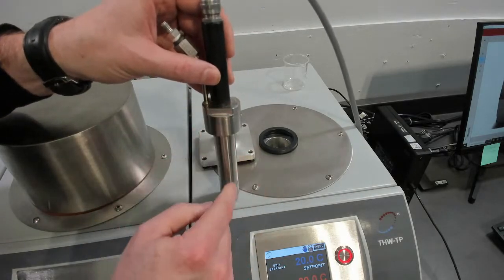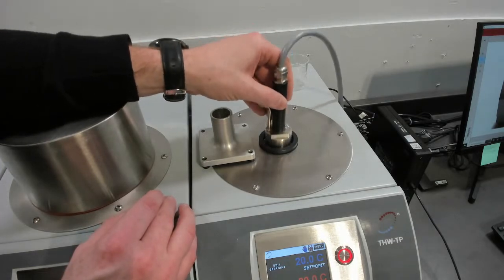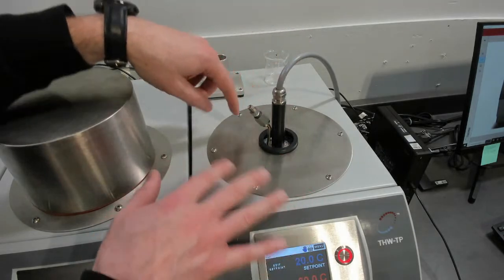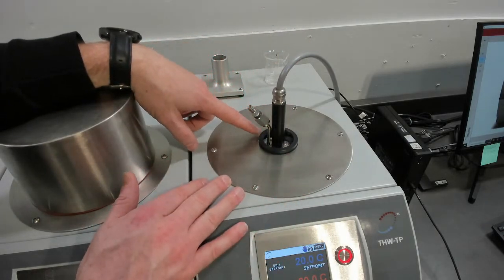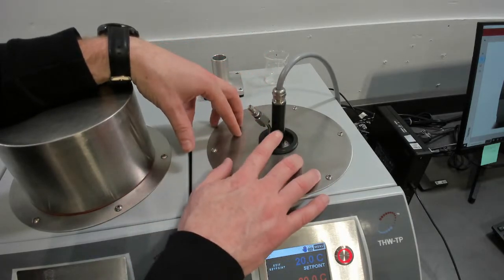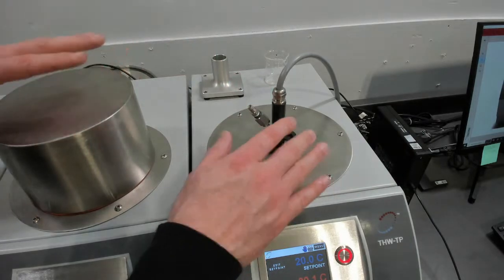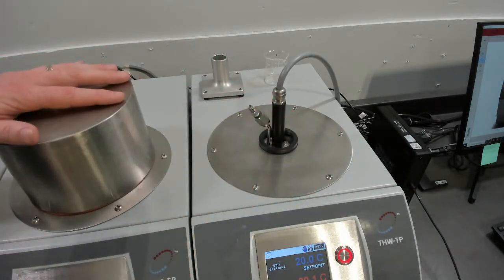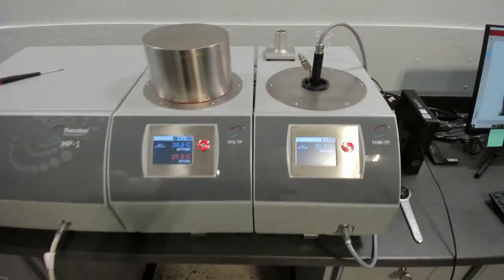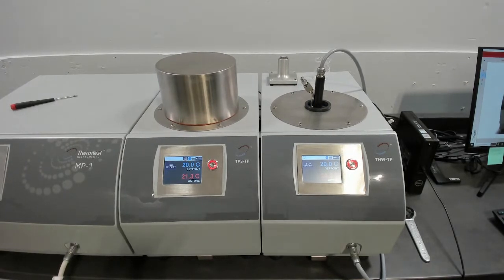So once you have your sensor loaded into your liquid, you place it in the temperature platform that's designed for the THW. And it works much the same way, it's just concealed. But you have a cold and heating opposing temperature to provide high accuracy control of temperature for the transient hot wire, just like the transient plane source. So in this case, we're setting up two experiments for control of temperature with the two available temperature platforms on the MP-1. So we'll share the screen.